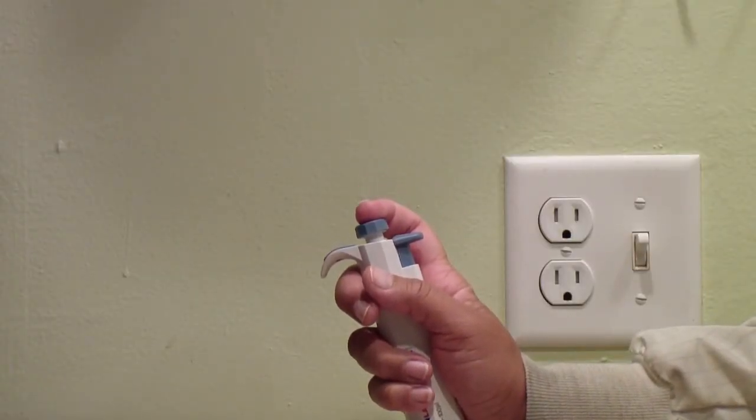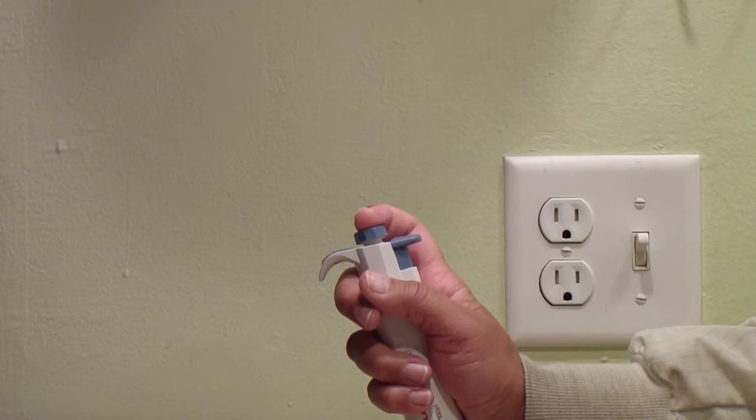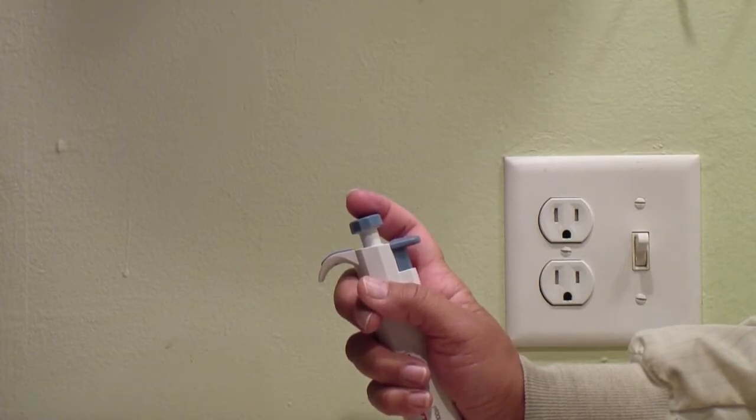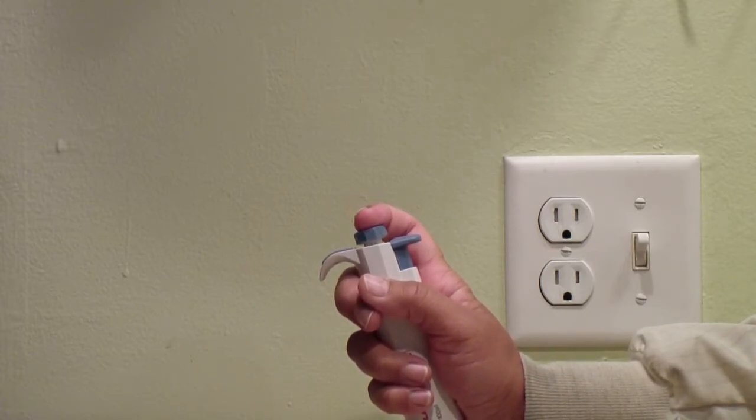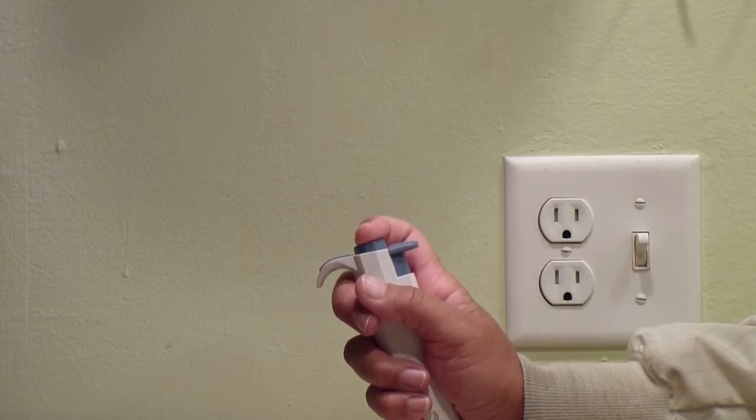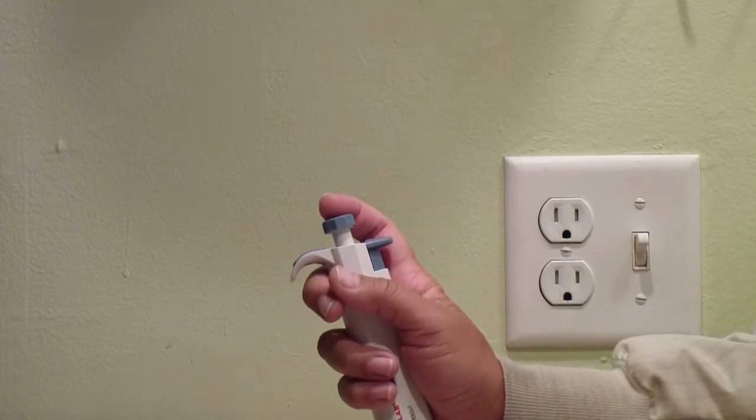You should practice stopping at the first stop, releasing the plunger by guiding it back up, and then pressing down to the first stop and the second stop. Try this several times until you are proficient in the use of the plunger.